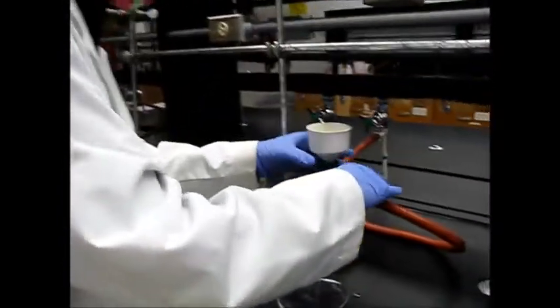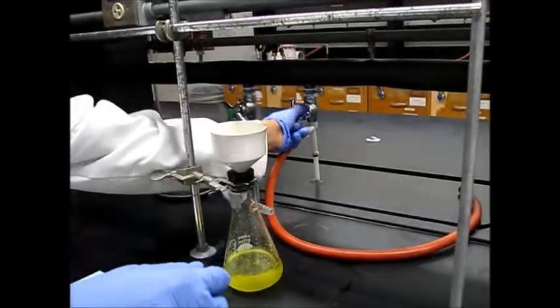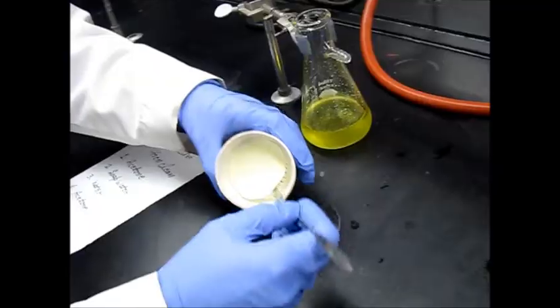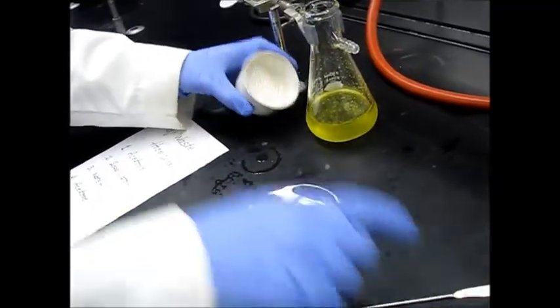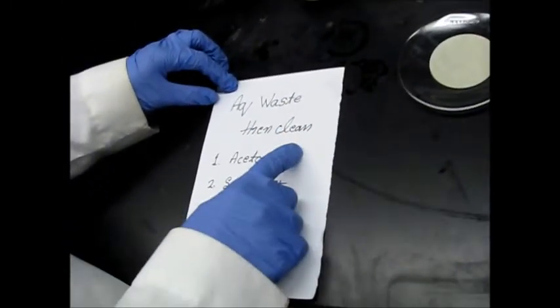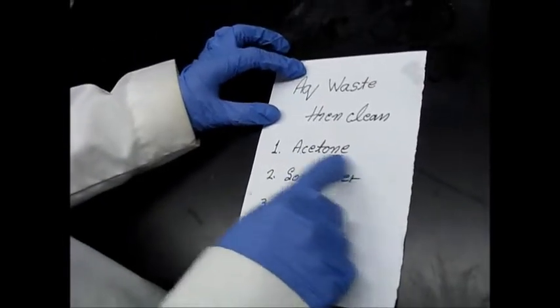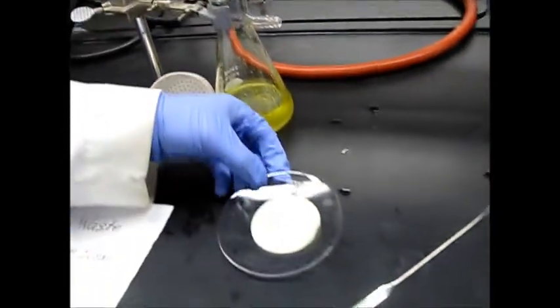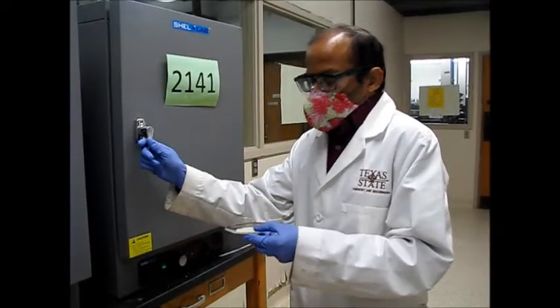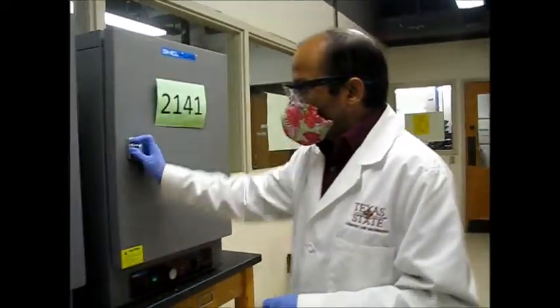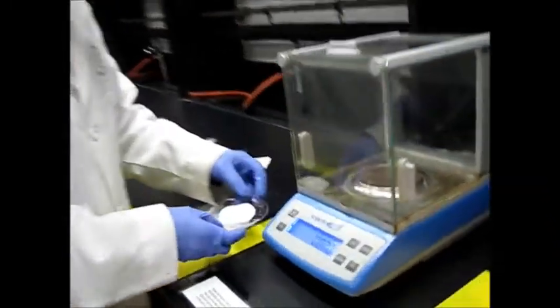So after 5 minutes remove this and then we have to clean this one. So for cleaning you have to throw this in the aqueous waste. Cleaning procedure is we have to wash with first rinse with acetone, then soap water, then water, then acetone. And now we'll go to keep this in the oven. So here we have dried benzoic acid crystals which we precipitated.